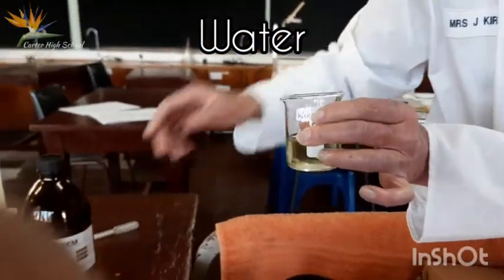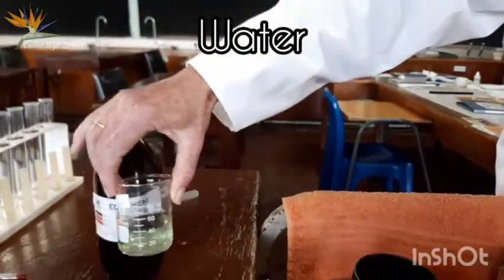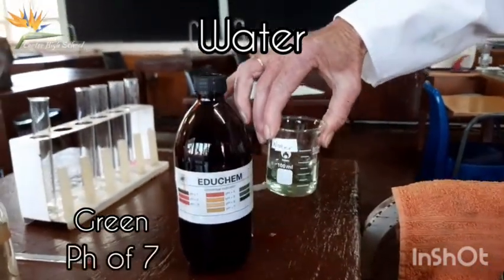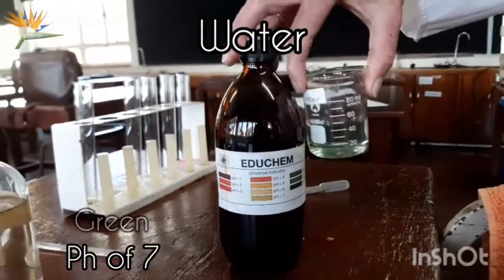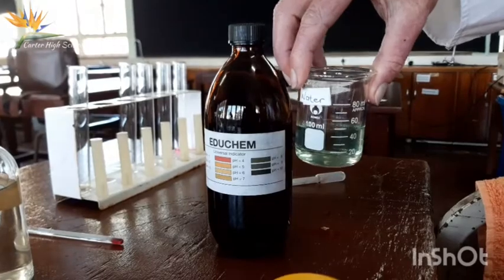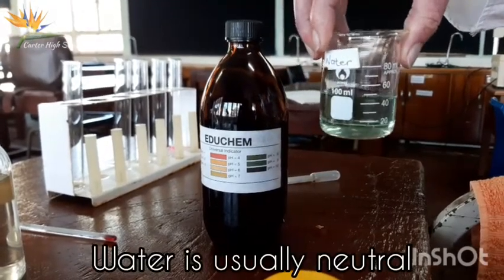And lastly, the water. Just plain water. Okay, that is green. Okay, that is a pH of 7. This one's almost 8. Okay, it's in between 7 and 8. We've got slightly alkaline water here, but normally water is neutral.